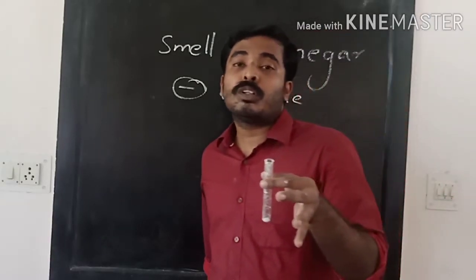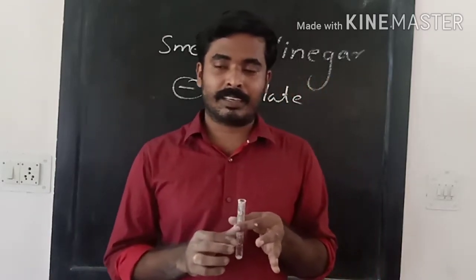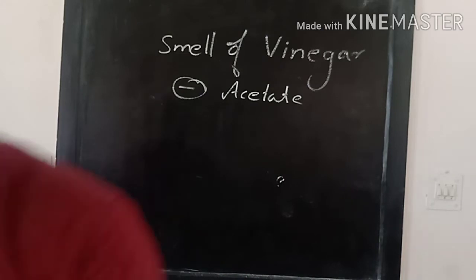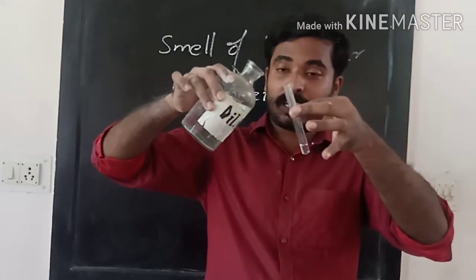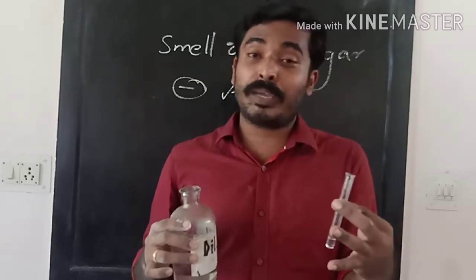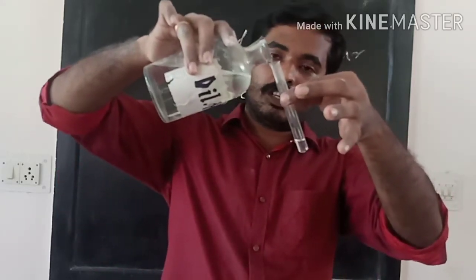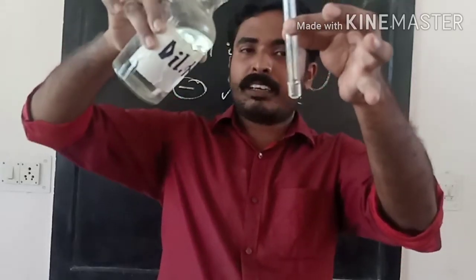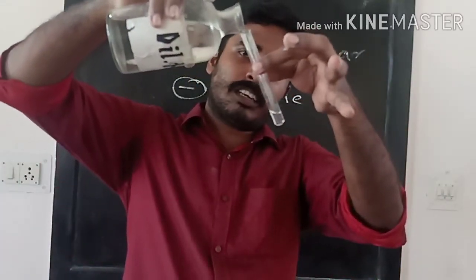We are going to do another experiment, which is also with dilute HCl. I have made a salt solution in the test tube. Then to that salt solution I am adding dilute HCl. If there is brisk effervescence, then there will be carbonate, which we have studied by now. Anyway, I am adding dilute HCl to it. Please observe the test tube carefully. What's happening? Whether there is brisk effervescence, whether there is any precipitate.